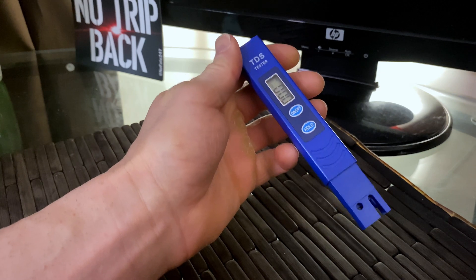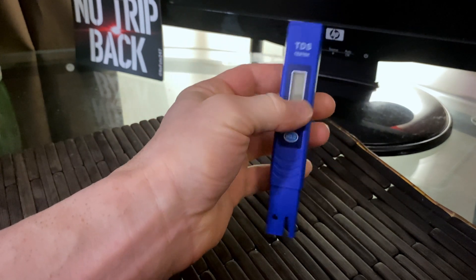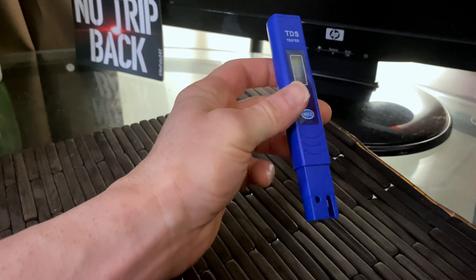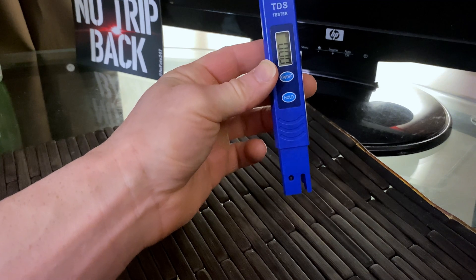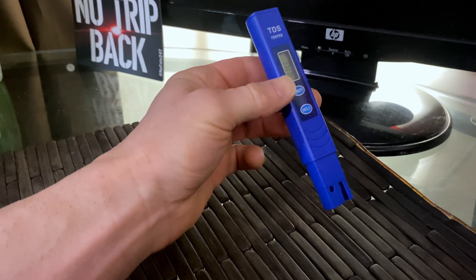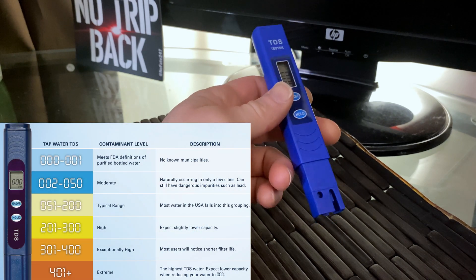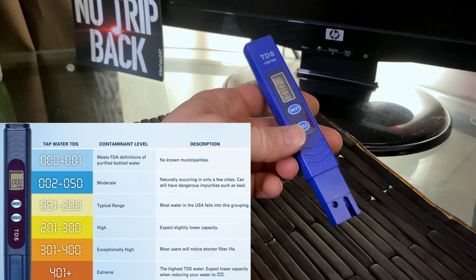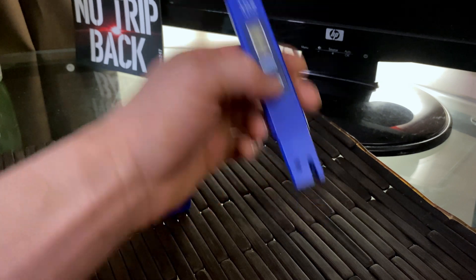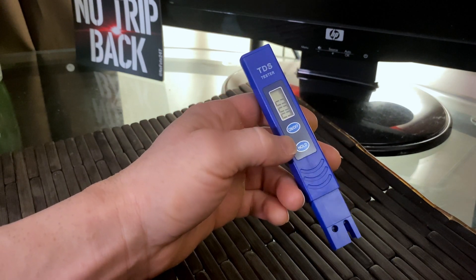If you're looking to measure your home water, even if you have a filter system, I would highly recommend getting yourself a TDS meter. How does it work? Take off the cap, fill up a cup of water from your tap or from your filtered water, put this in, and it's going to give you a number from zero to 700. Ideally it's going to be as close to zero as possible. If you want to hold the number steady, you can hit the hold button and that will keep the number on the display as you pull it out of the water. I think many of you are going to be surprised with the quality of your water.